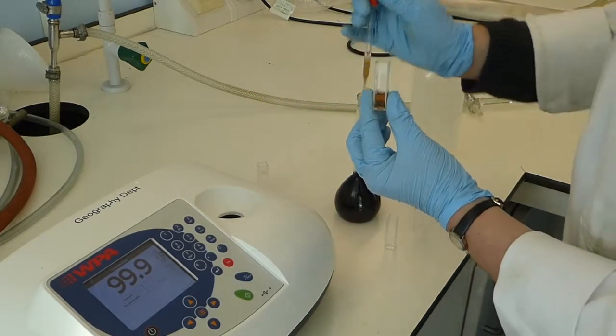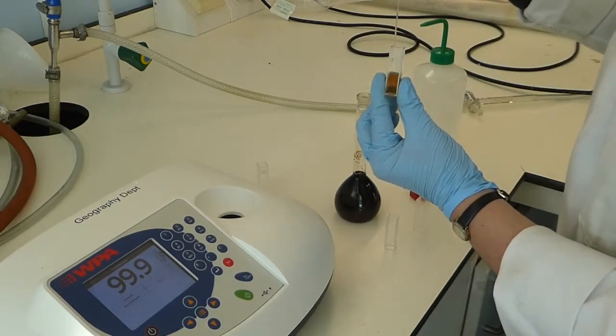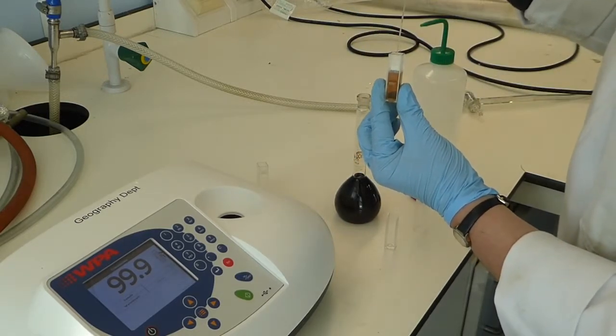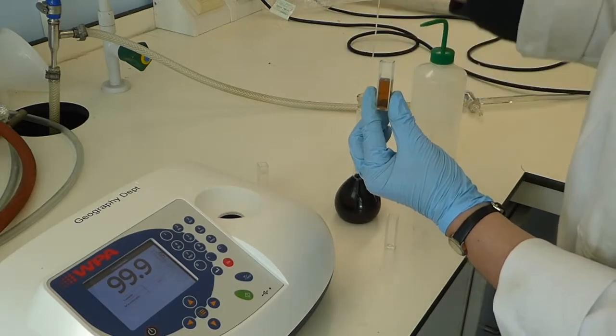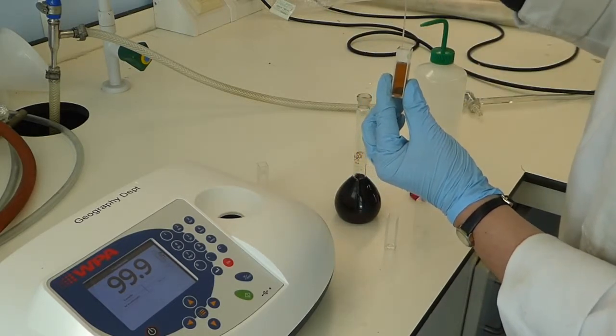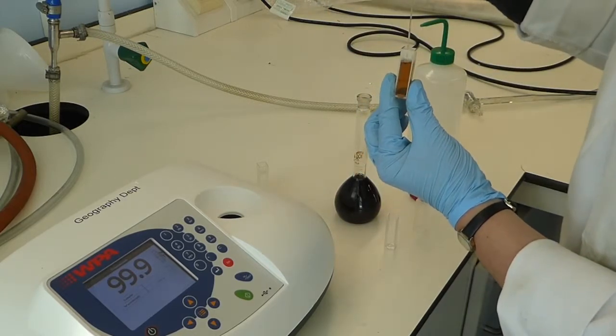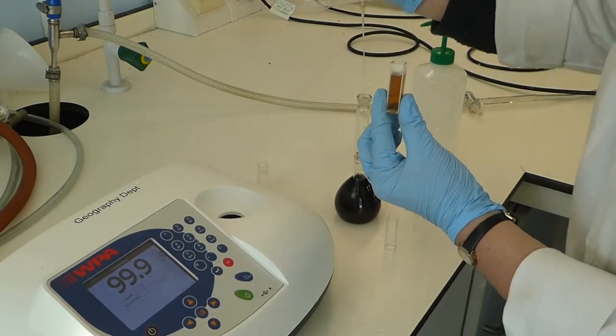You're now ready to analyze your sample. Again, you want to fill up to the mark, the line that I've just shown you, with your sample. It's frosted at the top so it's easy to see where you need to go to.